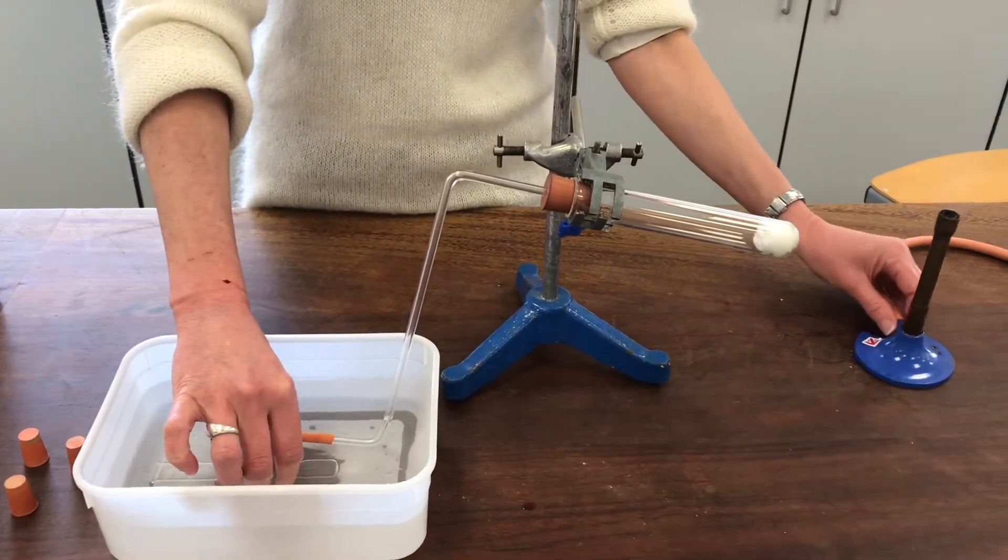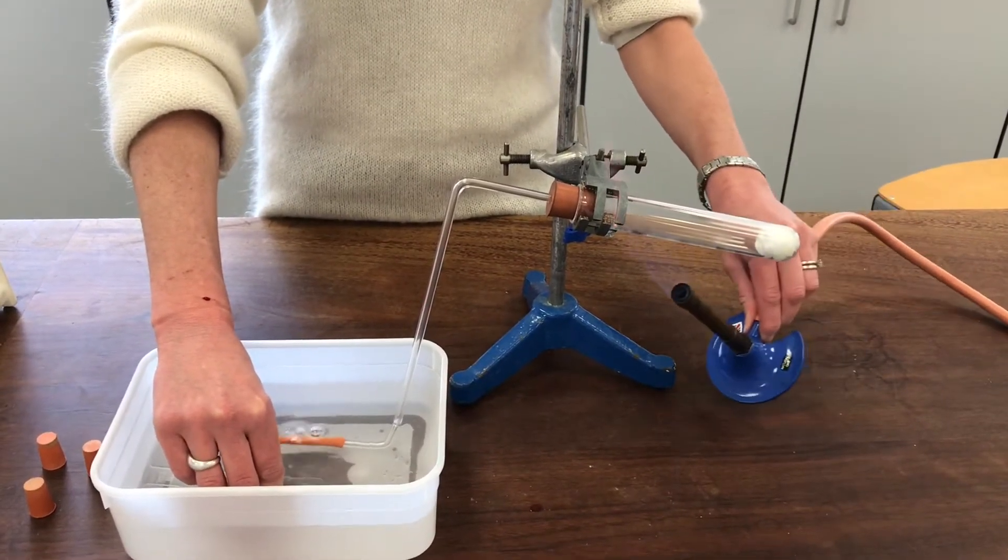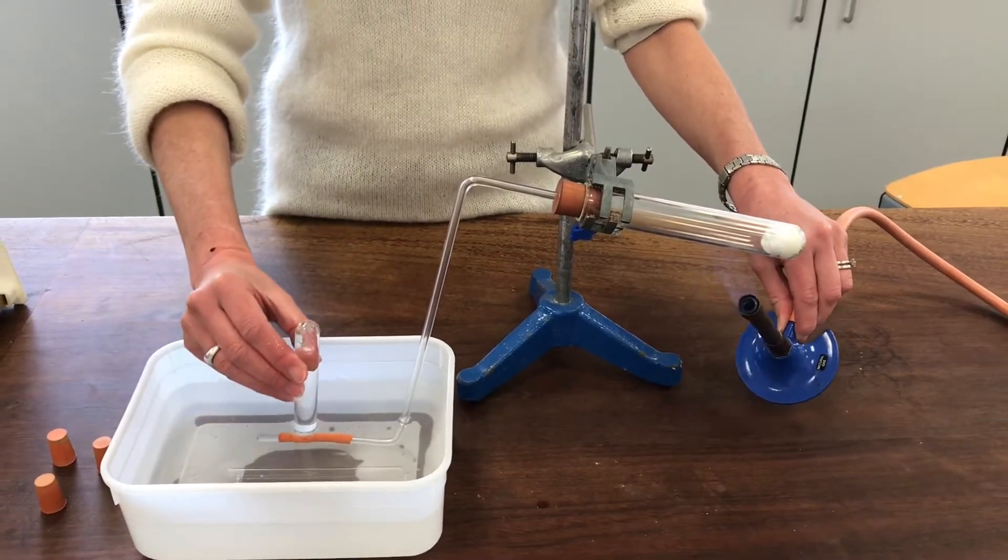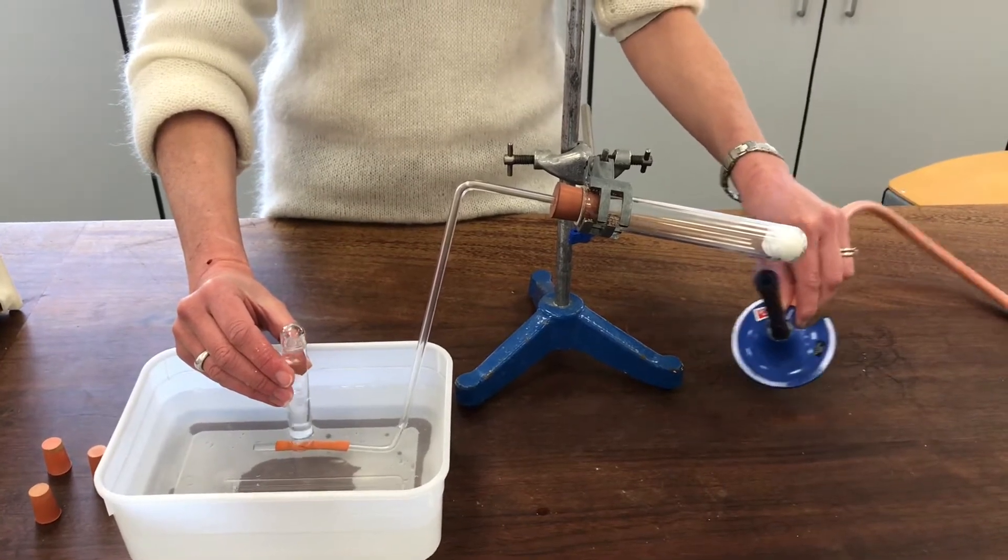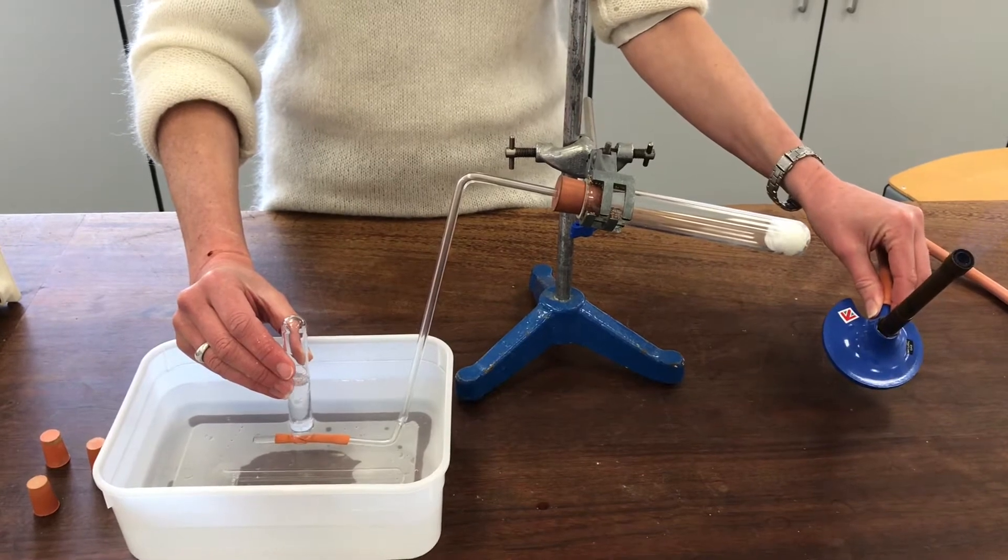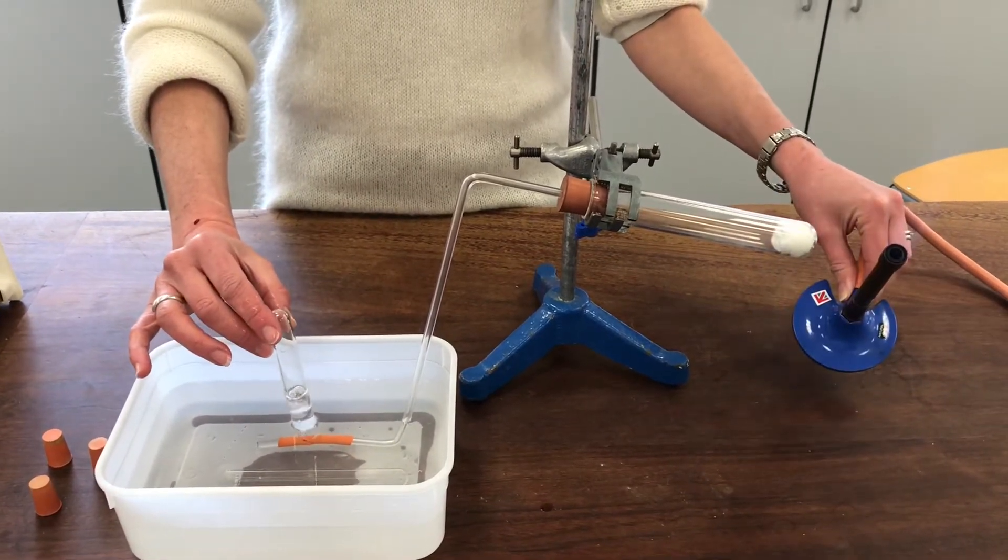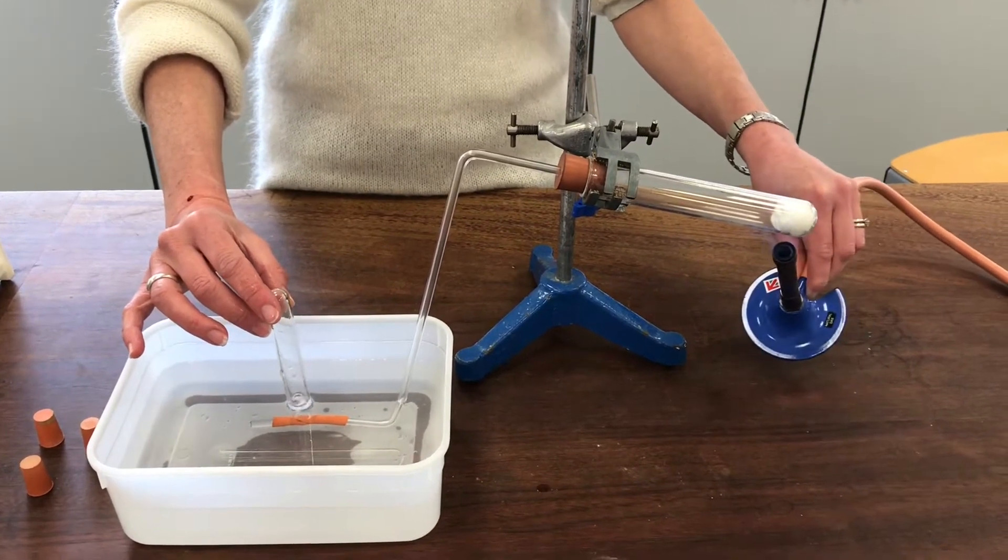So let it bubble for a little bit so I don't collect a whole load of air, and now I'll start collecting and hope I'm getting the product of this reaction. See if I can get several tubes of gas.